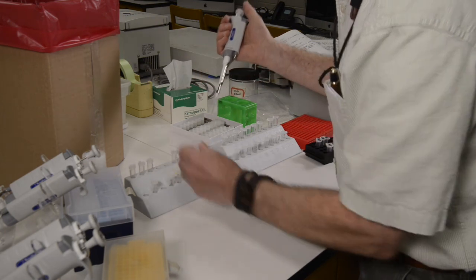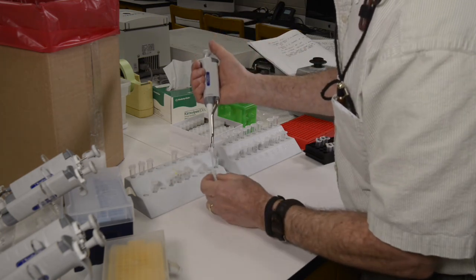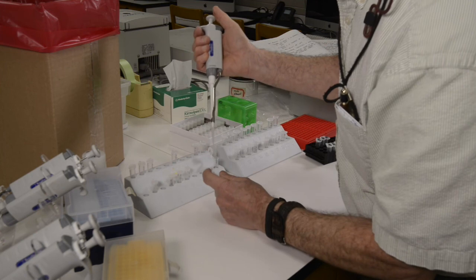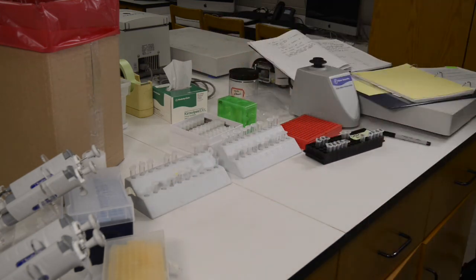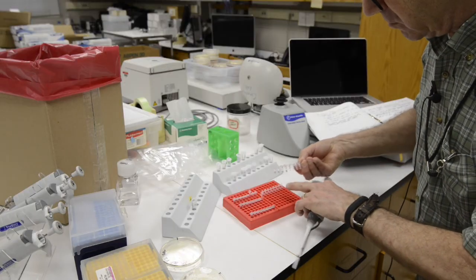So here I'm measuring out 100 microliters of the molecular grade water into individual sterile microfuge tubes.